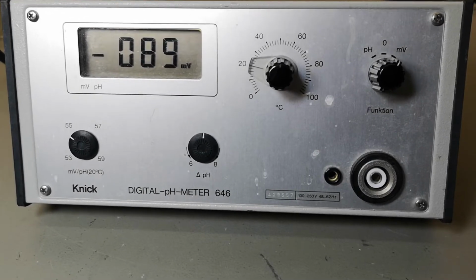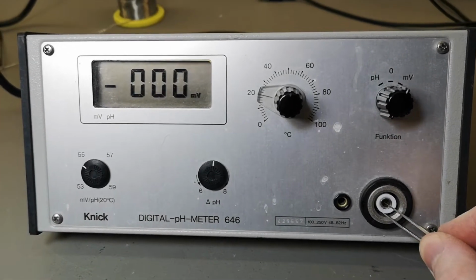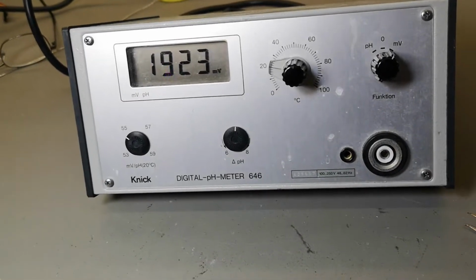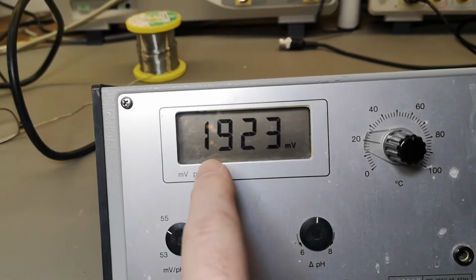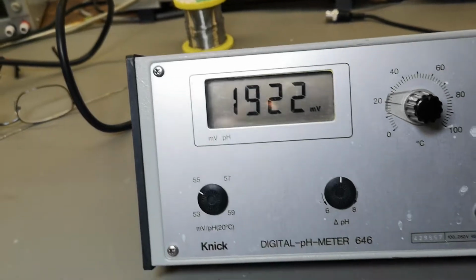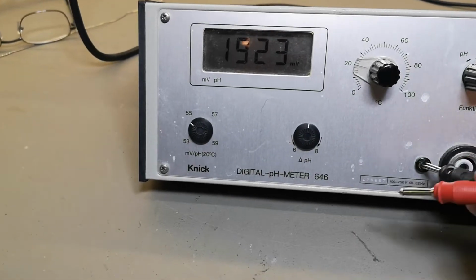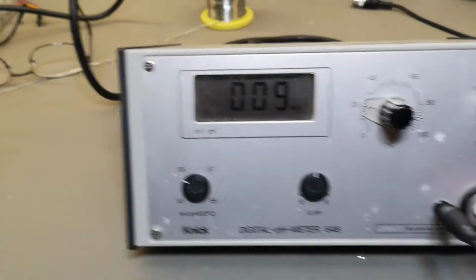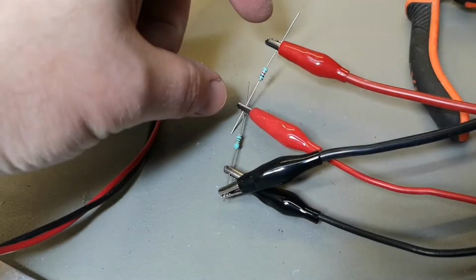And the first thing I did, I just took my tweezers, short circuited the input, and see, it's reading 0. So then I thought, hey, let's see if this millivolt thing is actually working. But now it's 1900. So that is a little bit odd. Because what I did is just took some banana connectors like this. And 10 ohms and 1K.